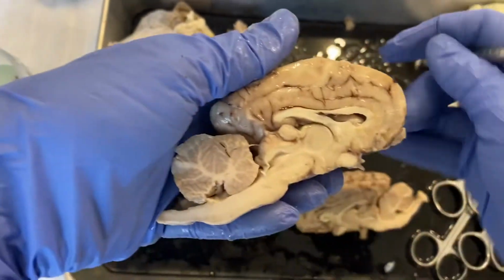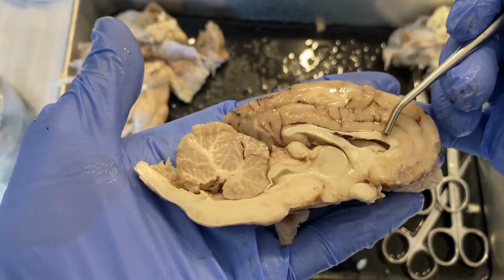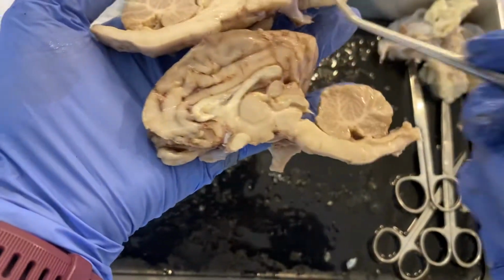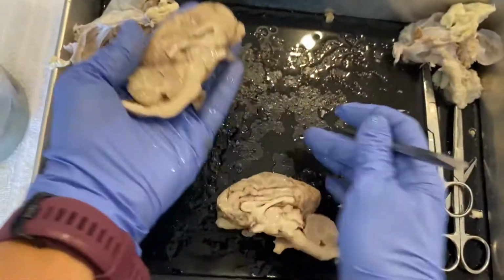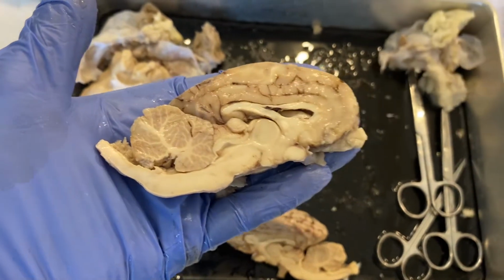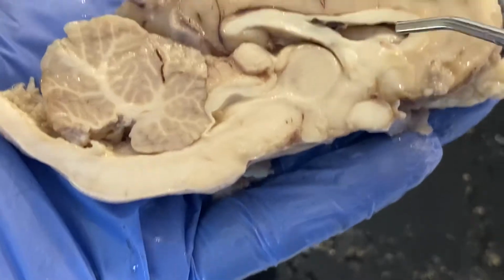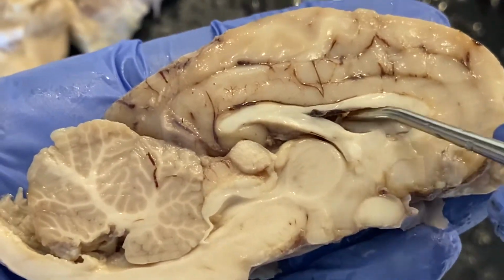As we look at it, we have here what is known as the corpus callosum. That is the communication between left and right brain, so we see it on both sides. I'm just going to work with the one right now. So this is our corpus callosum here as it goes through. Okay, this is our lateral ventricle. So you can see this space on the inside here.